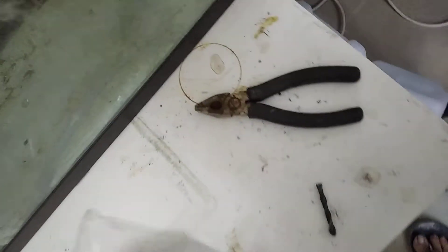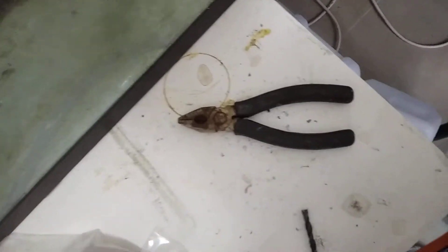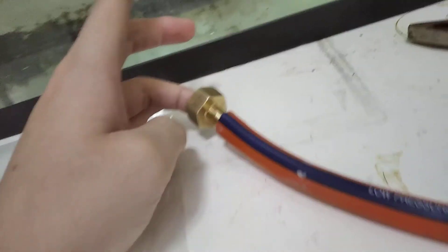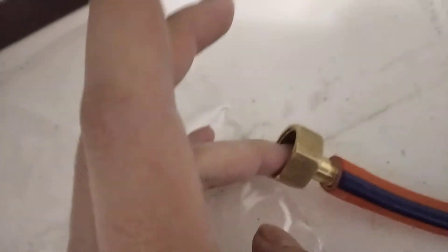Let's maybe use a Ziploc bag. No, I really have to take one for the team. Alright, as you can see, the vacuum is getting going and this thing has really sucked up my hand. Yeah, this stuff really works well. You can just plug up the snorkel so that the area is not so strong. This thing is really sucking up well.